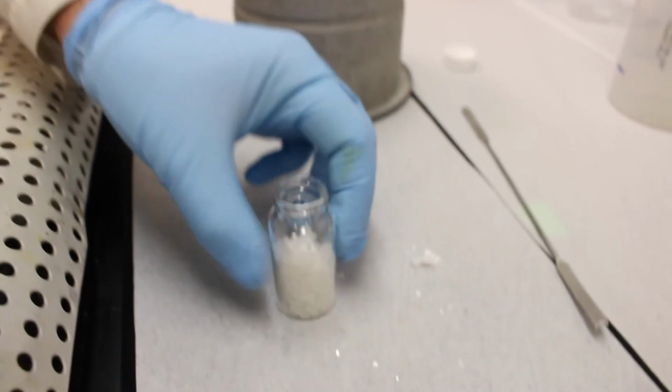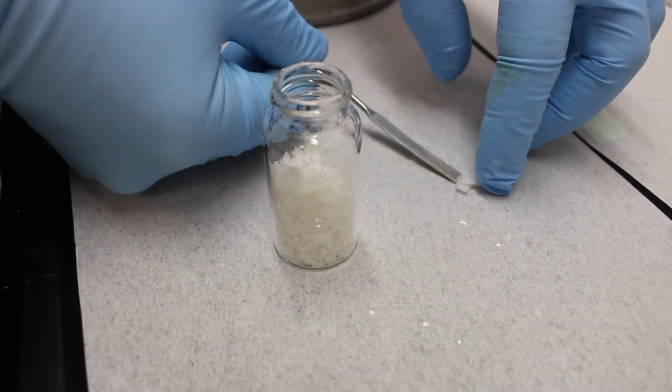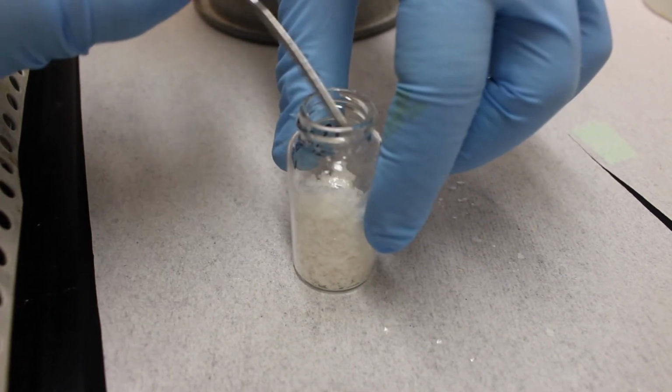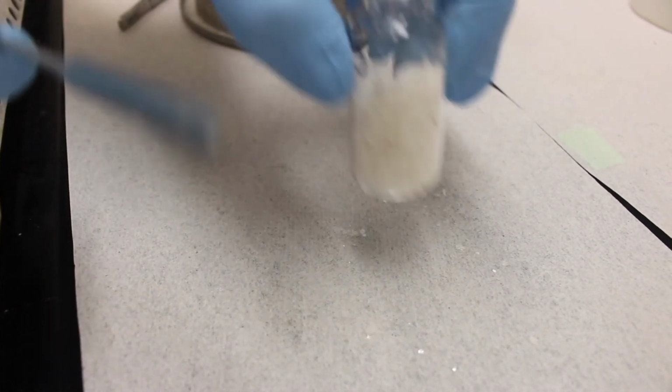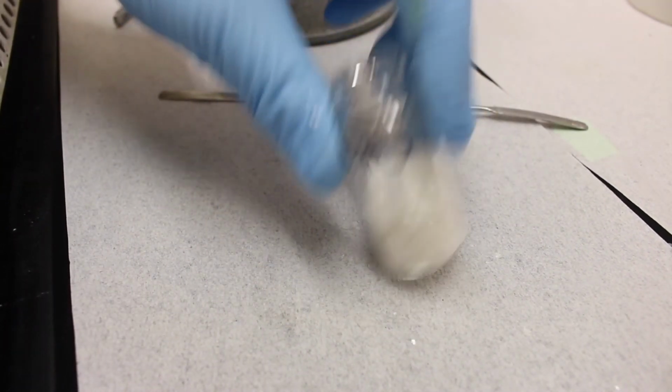Okay, as you can see, oh, there's a big crystal, so this is a clean surface, so you can do this. You can kind of take your spill and transfer it into the vial. And there's always going to be a little bit. Students always spill a little bit. It's kind of inevitable, but the amount you spill is so negligible. The majority of it is in here, which is what we want.